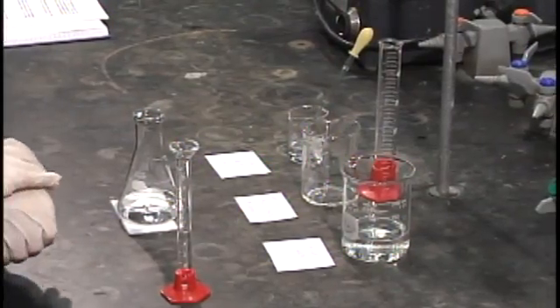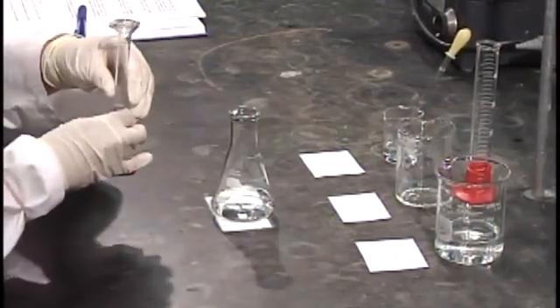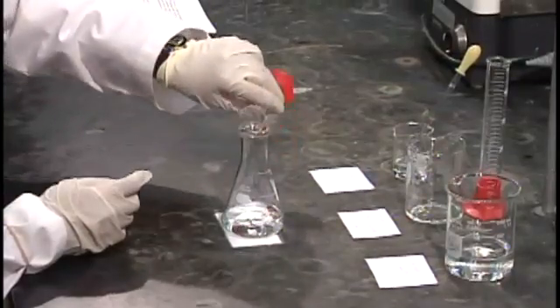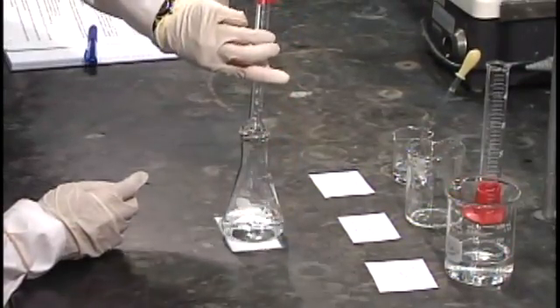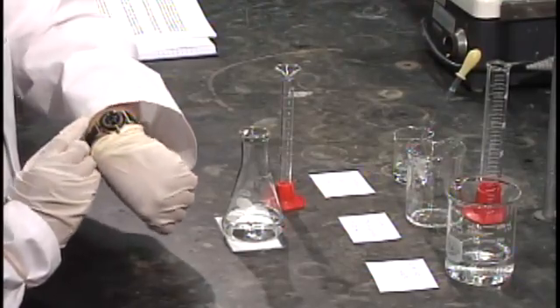As soon as we add that to our flask, we have to start timing. Set the timer to 0.